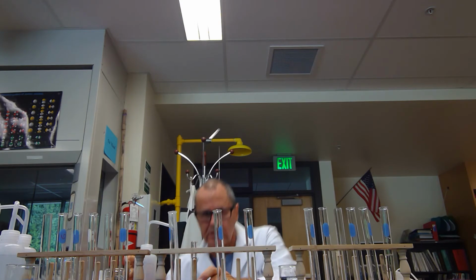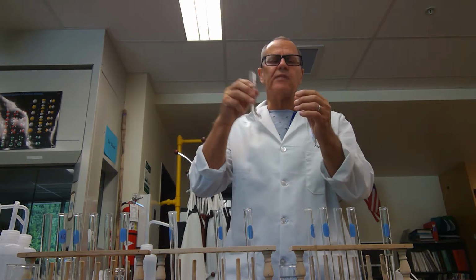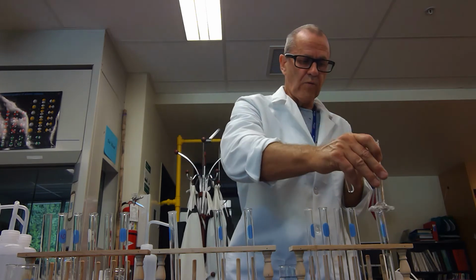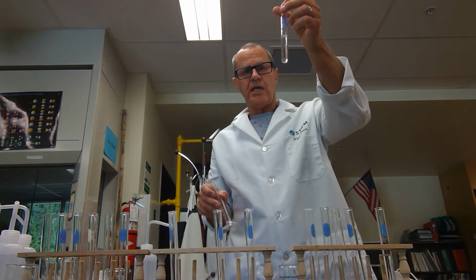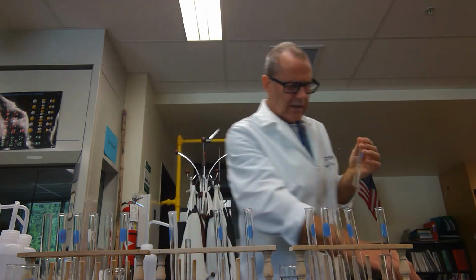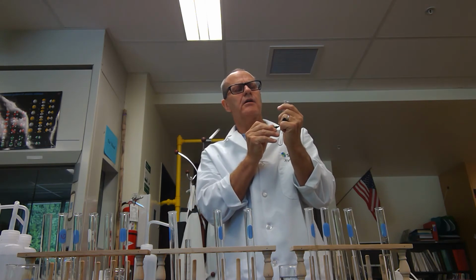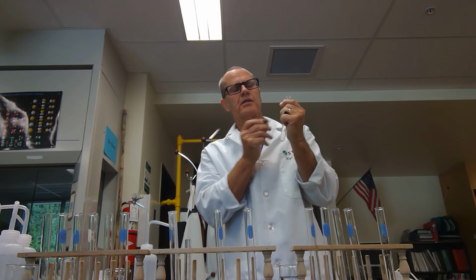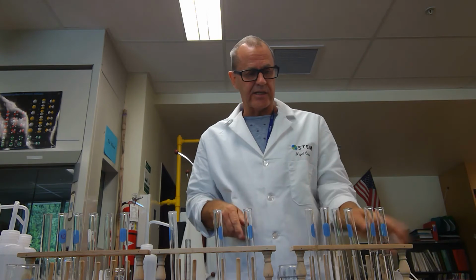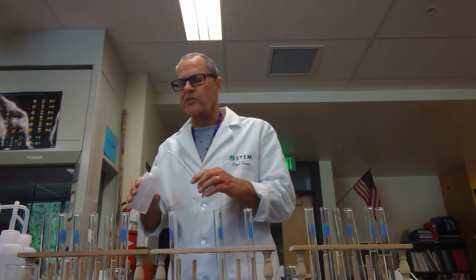So I've filled that up to 10 milliliters. And now I've got 1 milliliter of 1 molar and 9 milliliters to make it up to the 10 of the next one, which is water. And this is now 0.1 molar. And we'll see why that is when we get to the calculations, but that's not going to be now. Right, the next thing I do, now I'll give that a bit of a squirt out.